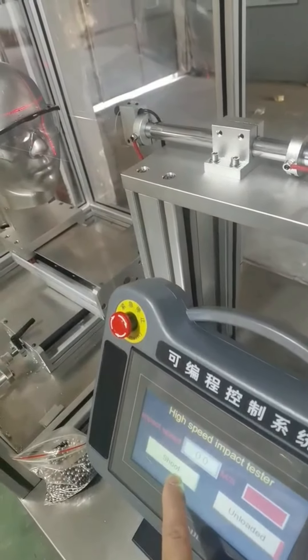You can see the container arm has no air pressure. Please check the air resource pressure to make sure it is about 0.5. Shoot after the air resource is normal.